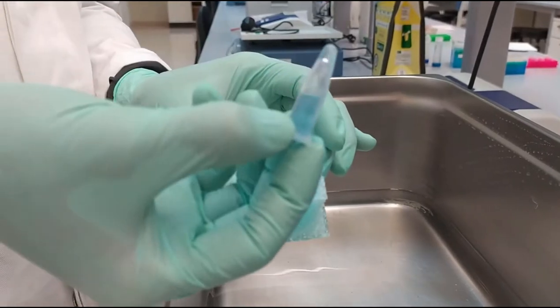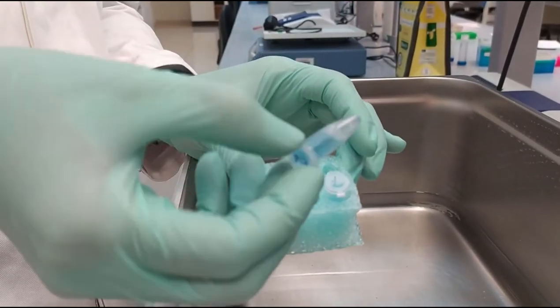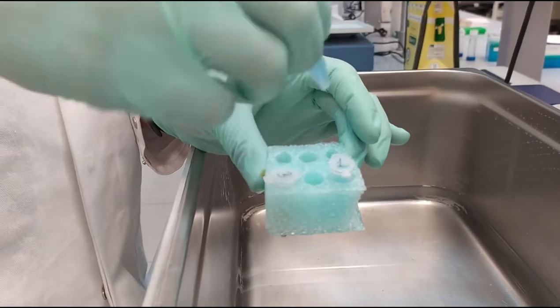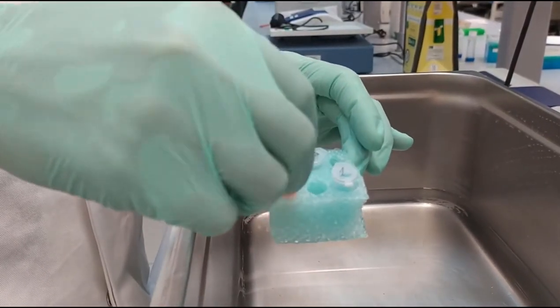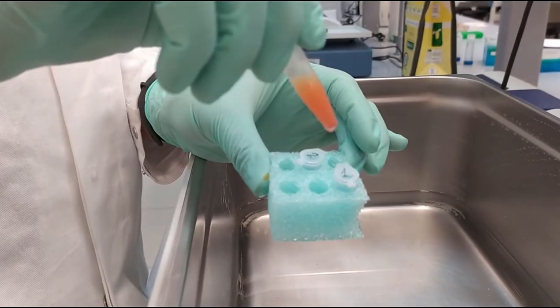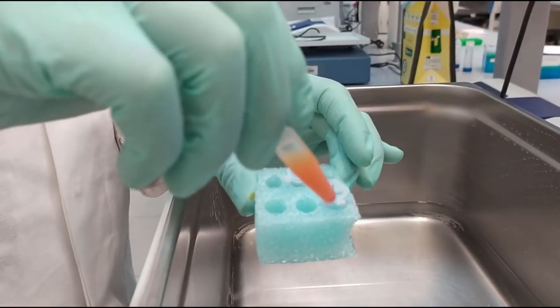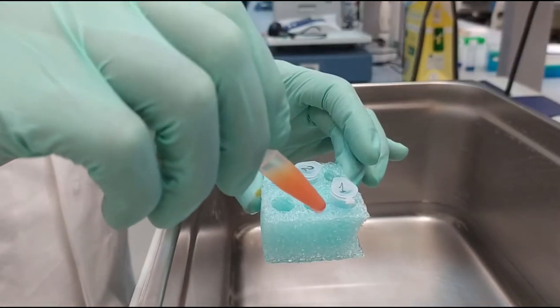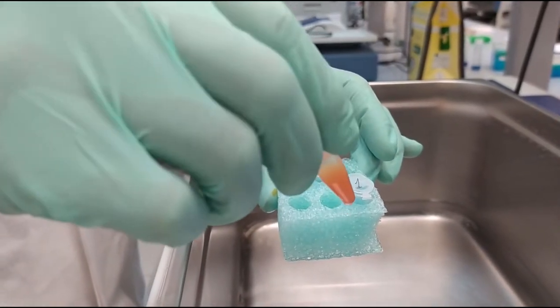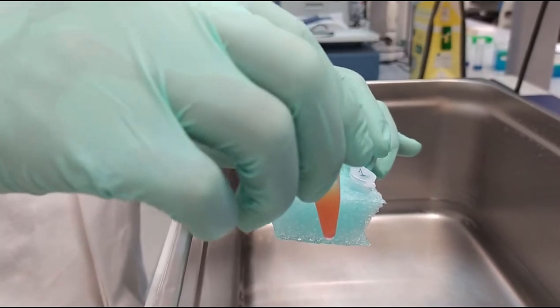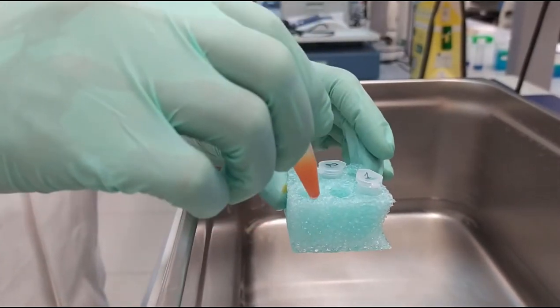So for the second one, we can say that it's again darker than the first one, but no much difference. And finally, we have the third solution. And the third solution actually shows the most drastic changes. And we can say that the third one had a reaction with the Benedict solution.